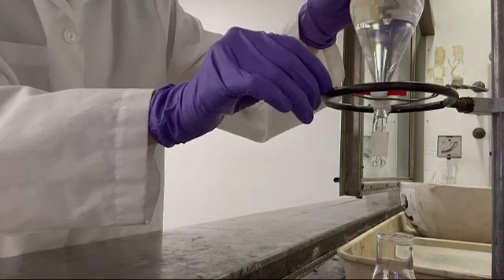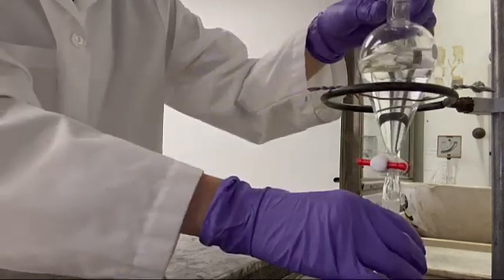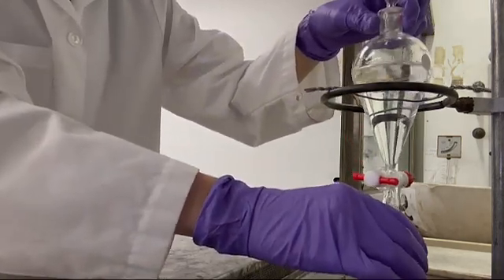Now we can let the layers sit and separate. Once the layers are separated, they can be drained.